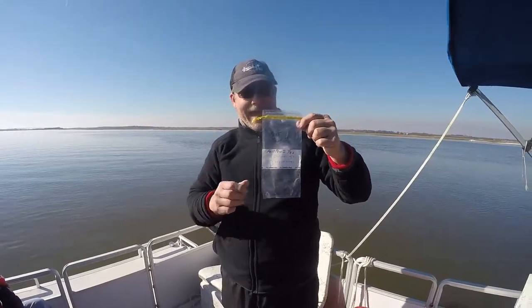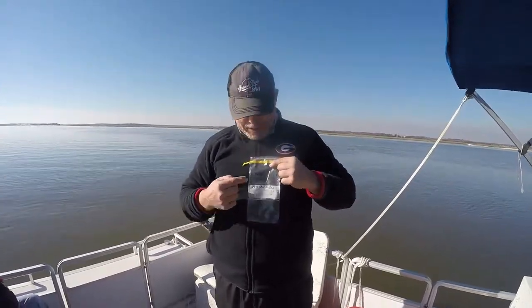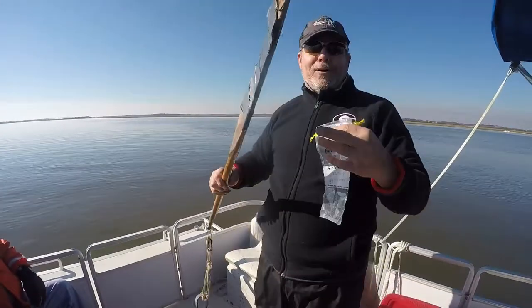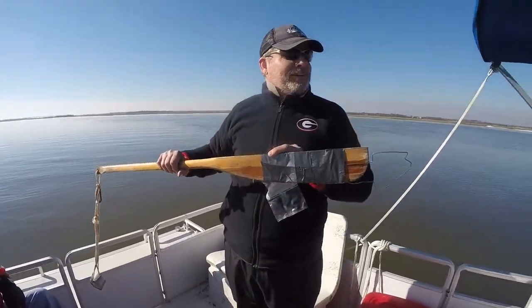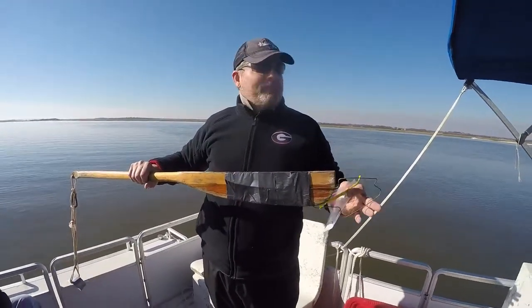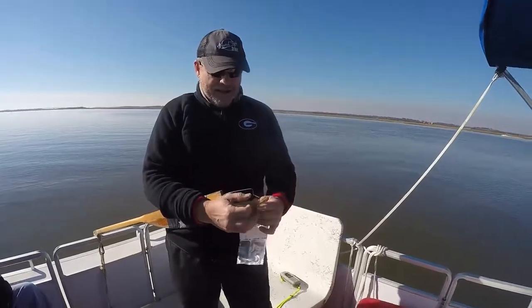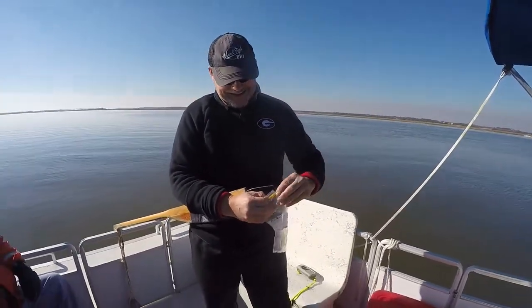We have our sample bag. We have it pre-marked ASI site one. We now are pulling out the magical testing device in the shape of a fish. Very important that it's the shape of a fish. They used to belong to a proctologist.